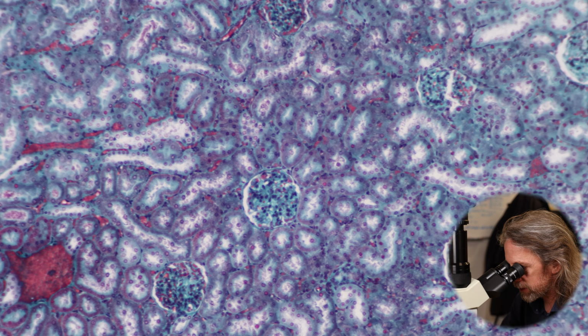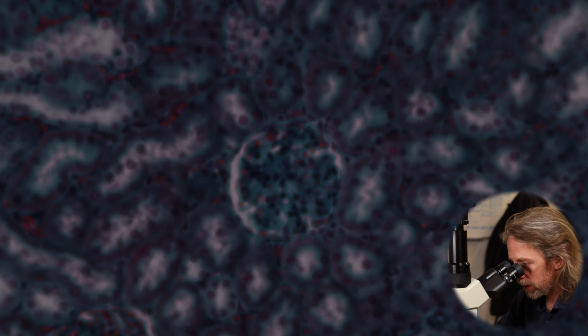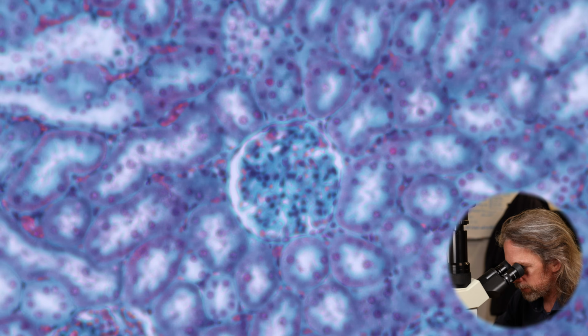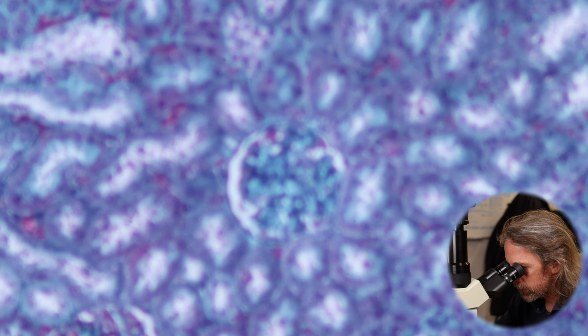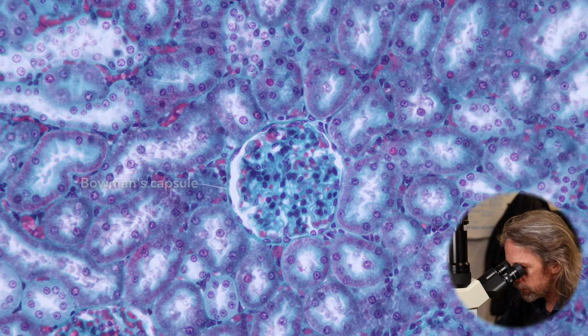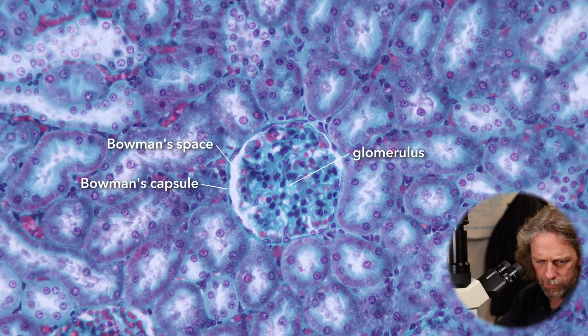So there's a nice one. If I jump up to my 20 times objective, give you a load more light. Very, very pretty, if nothing else.